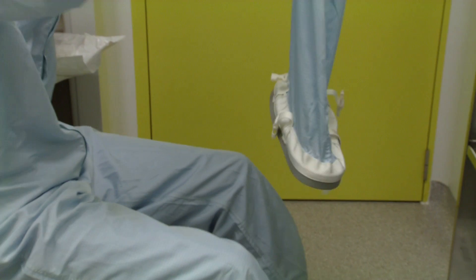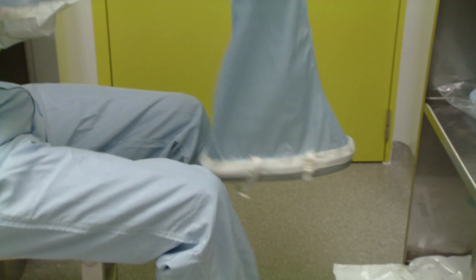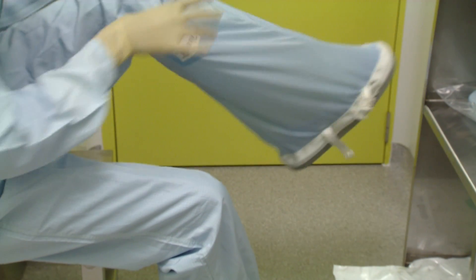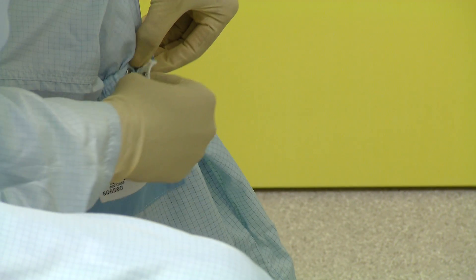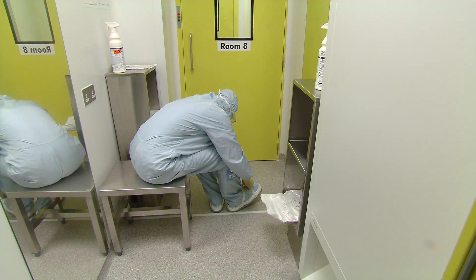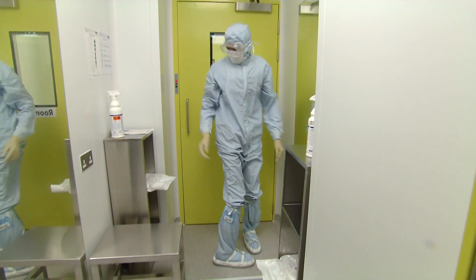To get into the clean room, into the grade A/B zone, is quite an achievement and takes a lot of training and skill. It's an area that when you go in to work, you go in and stay for a reasonable period of time, because there's quite a bit of work in getting in and likewise getting out. Typically, people in these areas go in and work on their focus tasks for two to three hours minimum.